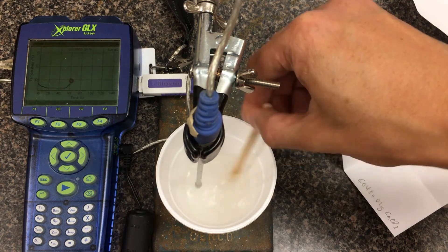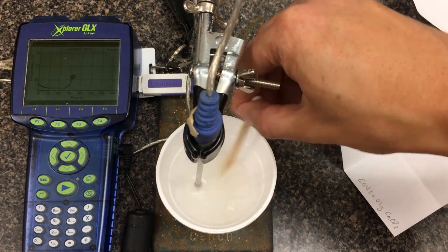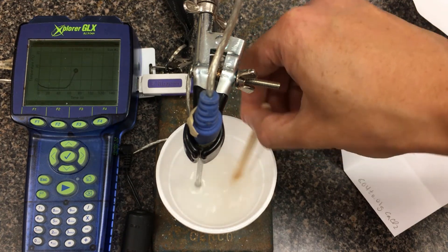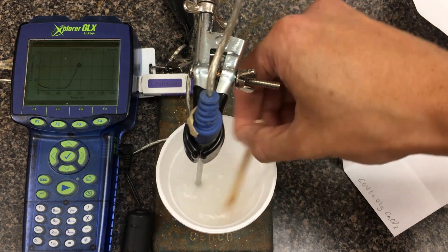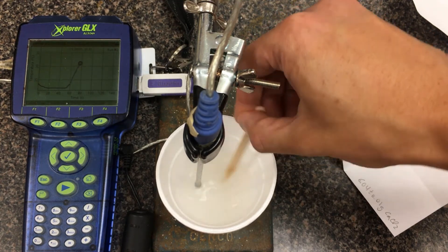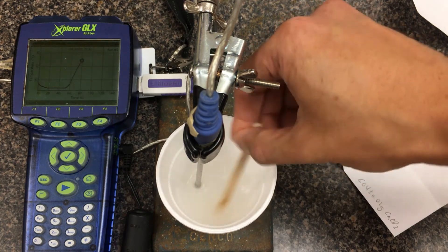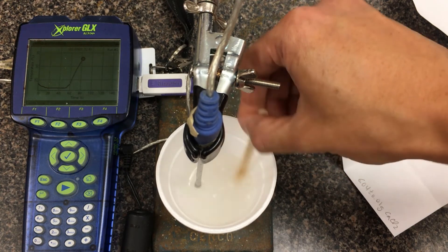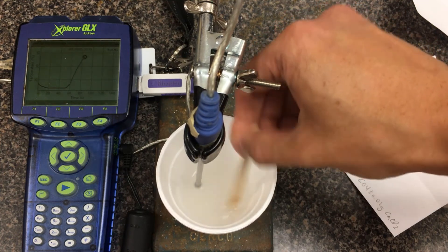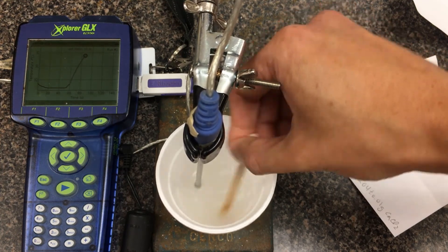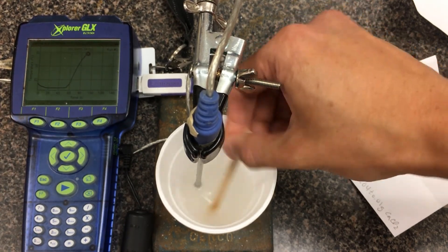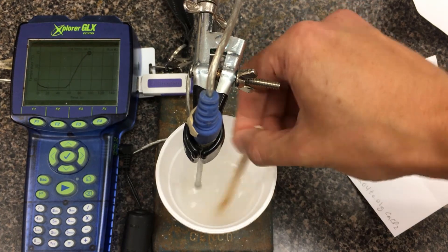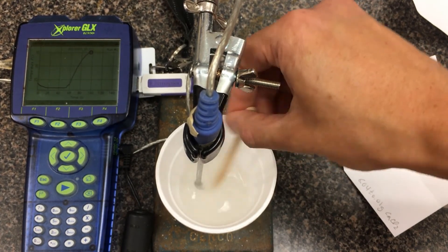Using a wooden stir stick, I'll start helping the powder dissolve. It is an exothermic reaction. Whenever they talk about temperature, we always think of ourselves as surroundings. Although the particles are losing energy, the potential energy diagram is going down, the surroundings are getting hot. We are never microscopic enough to be feeling what the system is doing, but we infer that the system is opposite of what we are. For this trial, we're going to use the new T-initial. It's exothermic, so we are heating up.